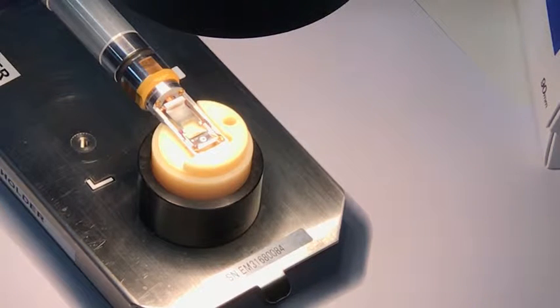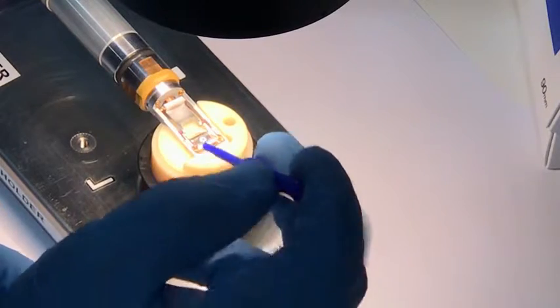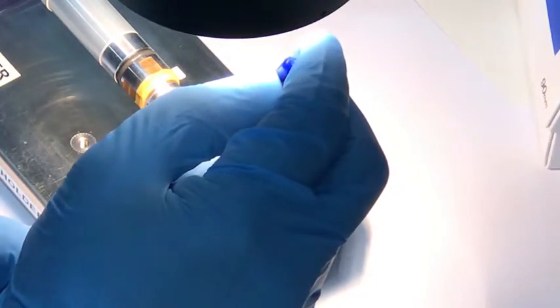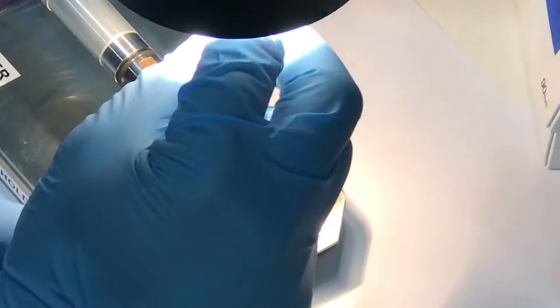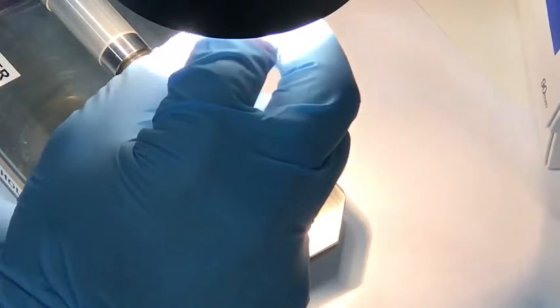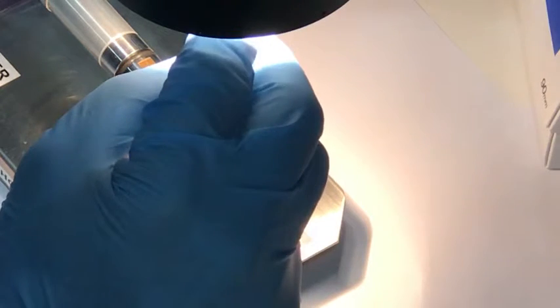So now I've set the specimen holder up on its stand. I'm going to switch on vacuum tweezers. I've already got the lights on and the binocular microscope set up. We've got a new plastic screwdriver which Russell King has replaced. He's replaced the other one because that was quite difficult to use this morning. So I'm just going to unscrew that nice and gently. Minimal pressure. And the other screw as well.